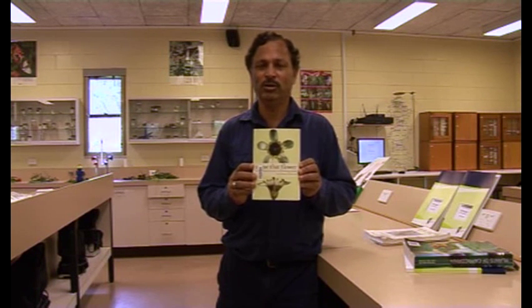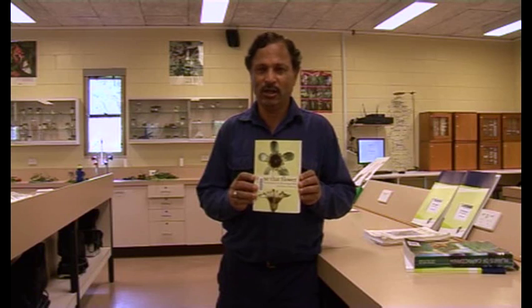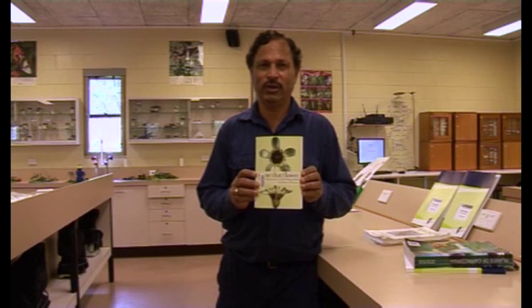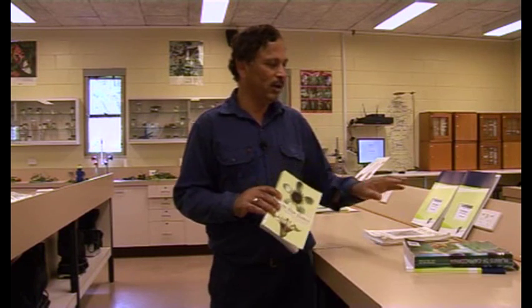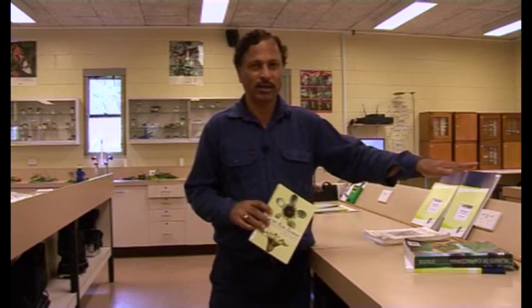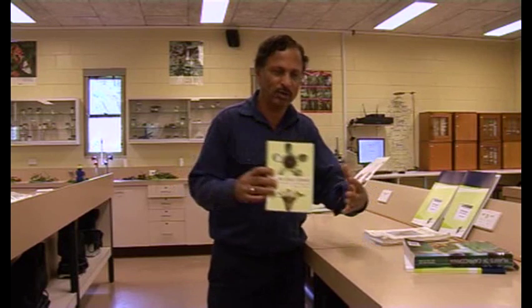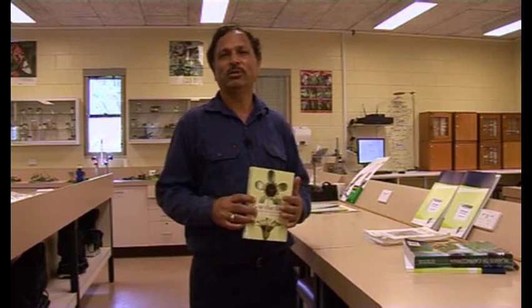Always make sure that you have all those resources available. If you get stuck with the identification, go back to your local book, the key, or maybe the study guide appendices and resource materials, so you will be able to get some information from them and put them all together to work through the specimen to find the right name.